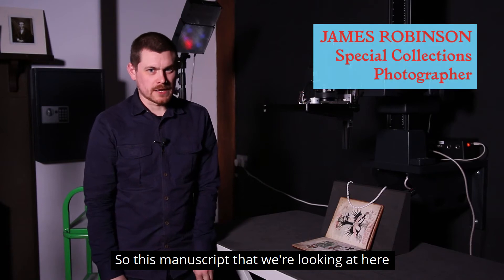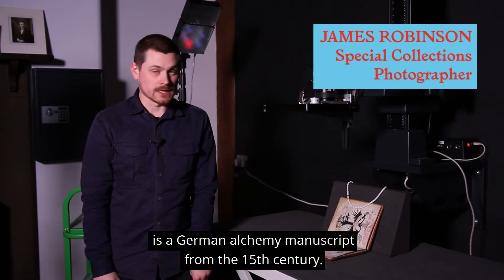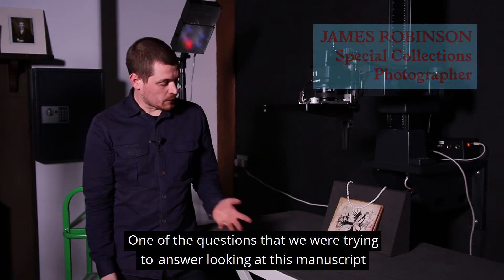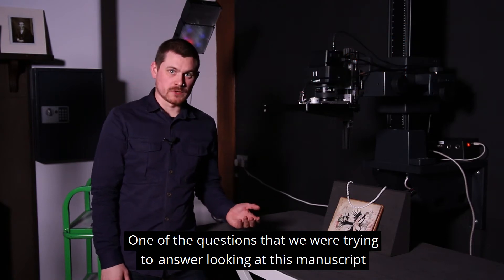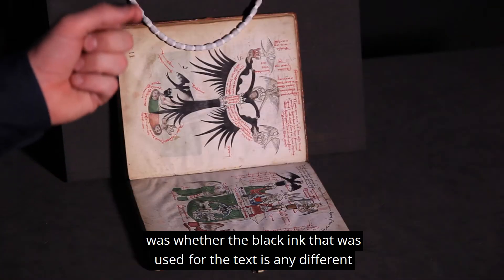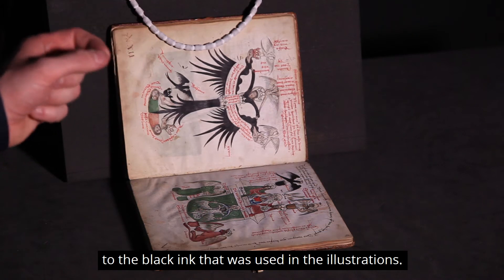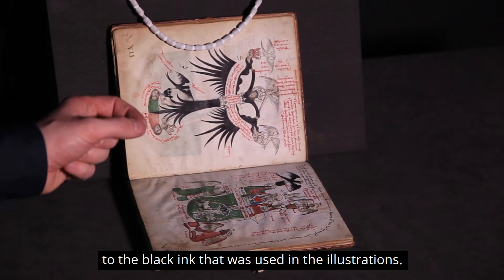This manuscript we're looking at is a German alchemy manuscript from the 15th century. One of the questions we were trying to answer was whether the black ink used for the text is any different to the black ink used in the illustrations.